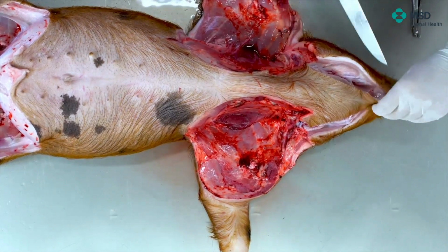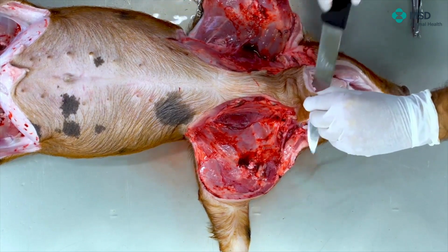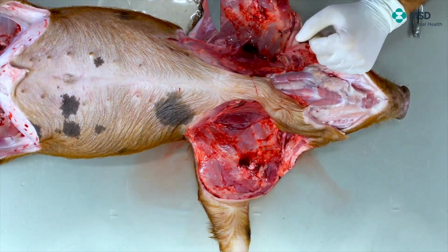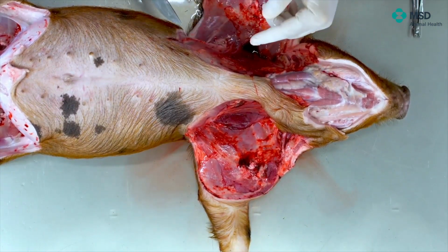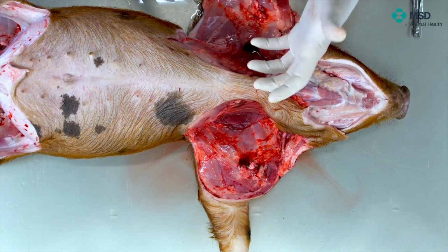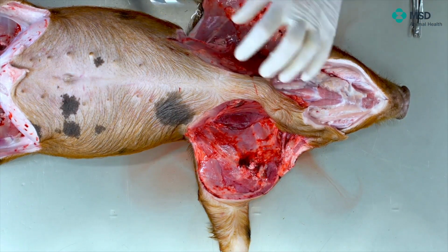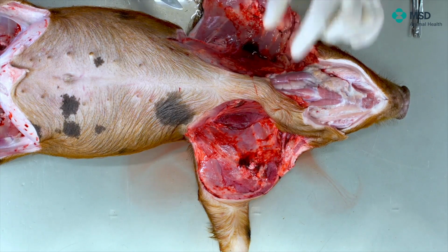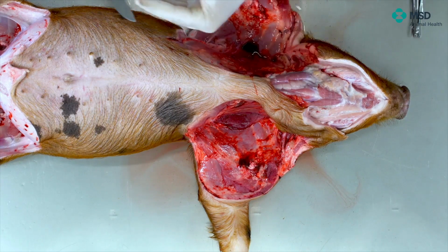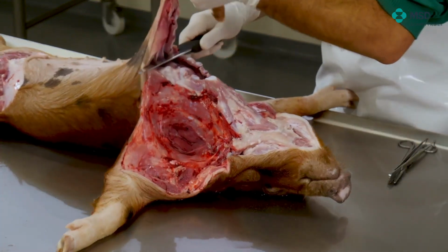In order to proceed for the opening of the thoracic cavity, sometimes we are using what we call the costotome in order to cut the costal wall, so the ribs. However, instead of cutting the ribs by the bone, we will try to cut them by the cartilaginous area. So the point is to try to cut, as we can see here, at the cartilaginous area. And first of all, I have been opening just the thoracic cavity, but this is a procedure that can be performed very fast, and then open as well the abdominal cavity.